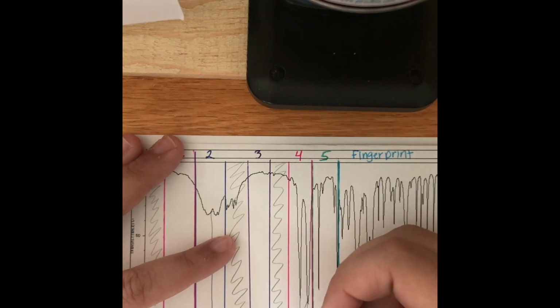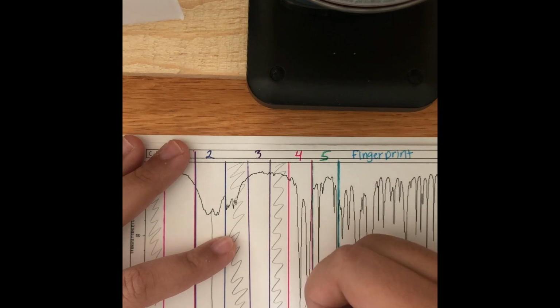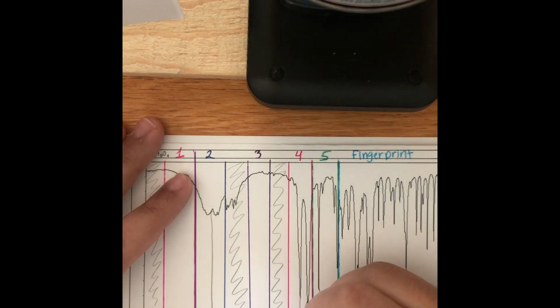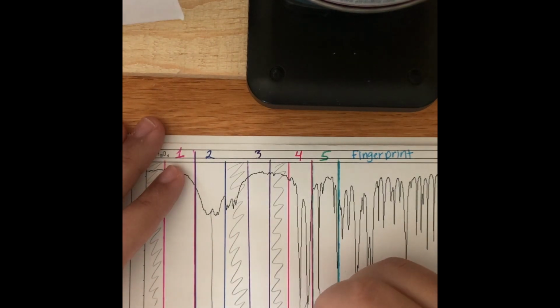So that's all for zone 4. And now when we look in zone 5, right here, this peak, that's a benzene peak, which, if we remember when we were looking at the mass spectra and we did the degrees of unsaturation, we know that we're going to have some rings in there, and double bonds as well, which is covered in the benzene peak.